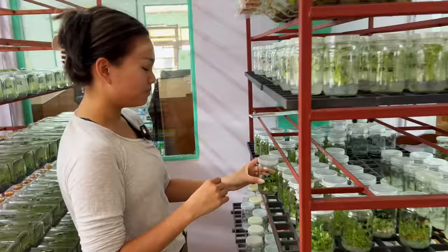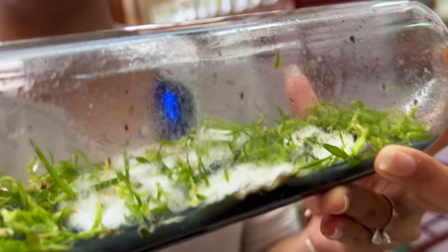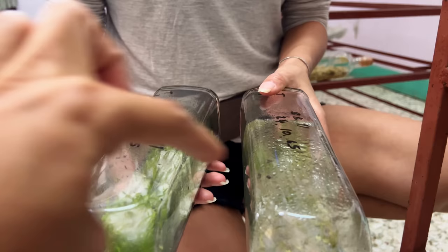Let me show you something right here. Is that mold? Yes, it's bacteria — no good. There could be so many reasons you get bacteria. You can see the differences between the two molds — they're not the same. This one is light and this is a dark mold, and they're from two different causes.